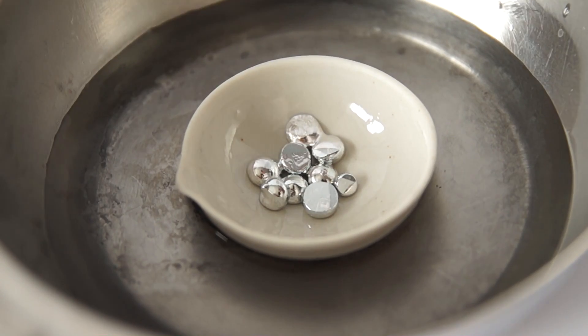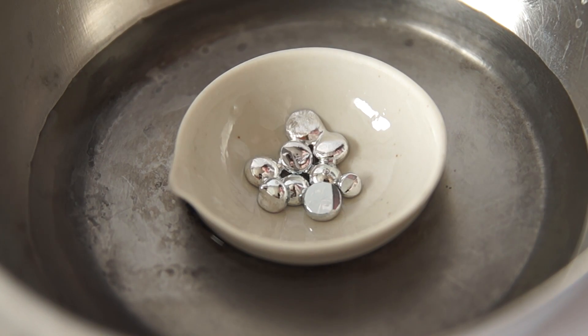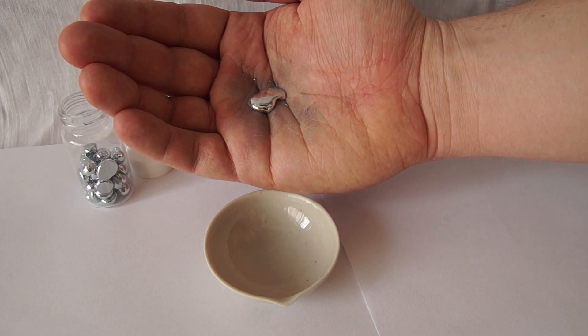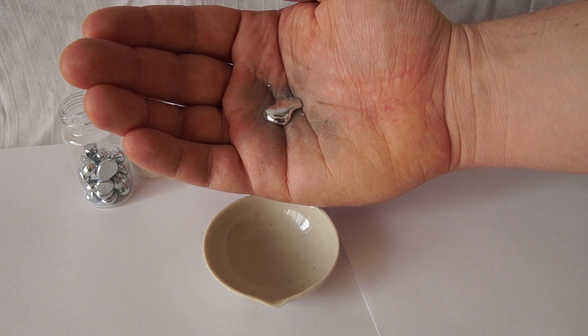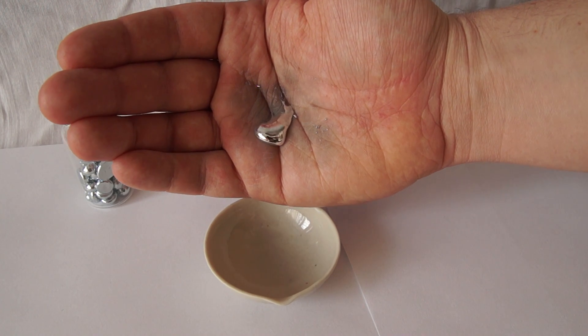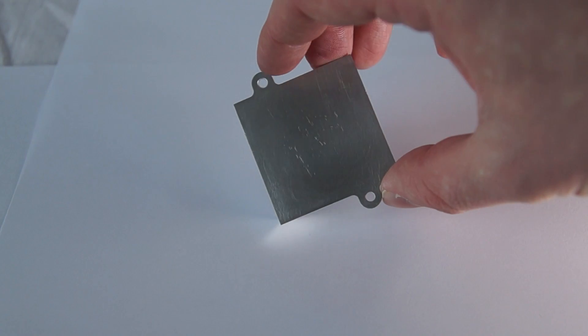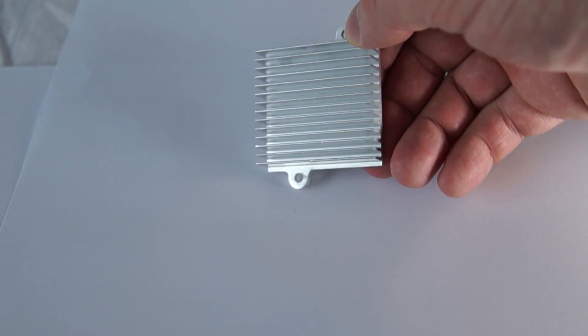Hello everyone! Today we are going to carry out further experiments with an unusual metal gallium. This metal has one interesting feature. It's able to create an amalgam with another metal such as aluminum or iron. To demonstrate this property I'll conduct an experiment.